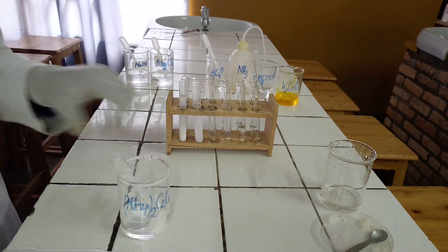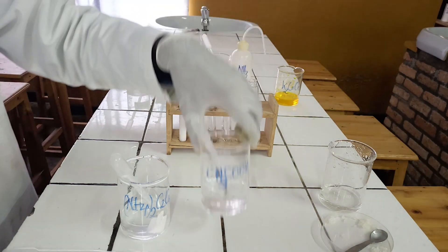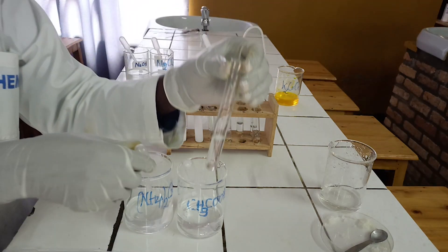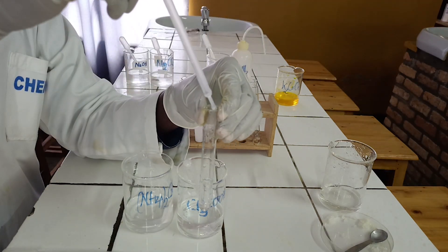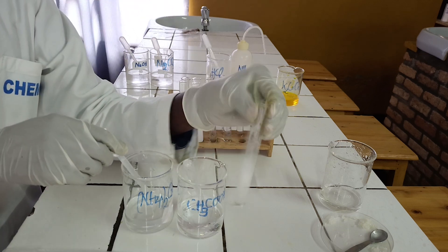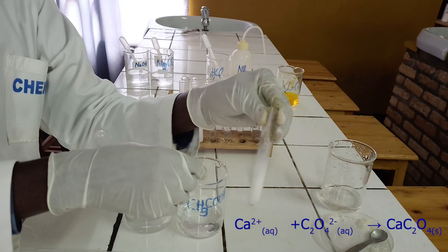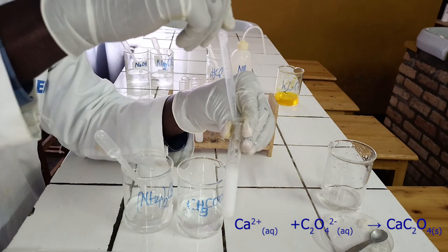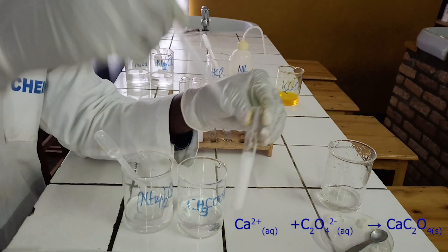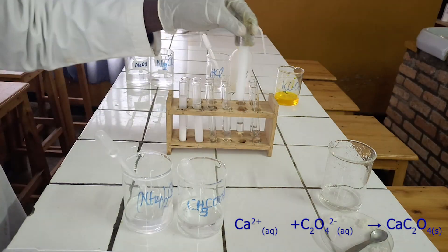Confirmatory test. To the fifth test tube, add a few drops of ammonium oxalate solution followed by acetic acid. As you see, ammonium oxalate reacts with calcium ion to form a white precipitate, which is insoluble in acetic acid solution. Below, there is an ionic equation for this reaction.